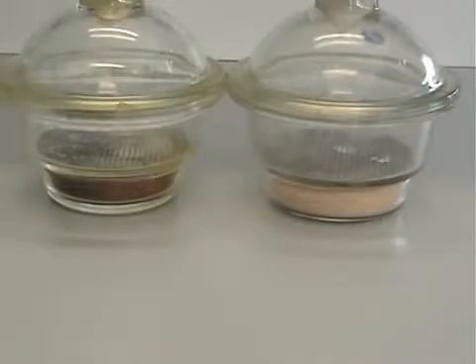For a desiccator to function properly, its desiccant must be fresh. On the left of this image is the bright orange fresh desiccant, on the right is the hydrated used desiccant.